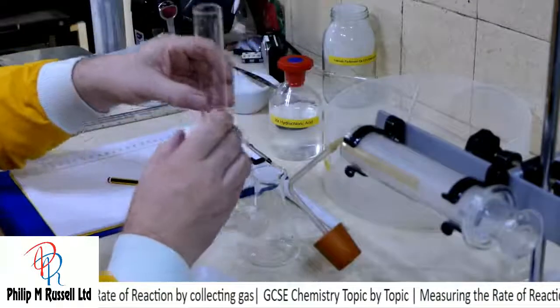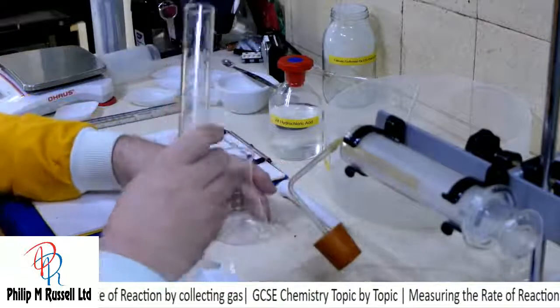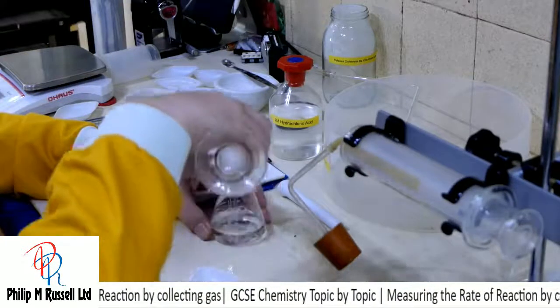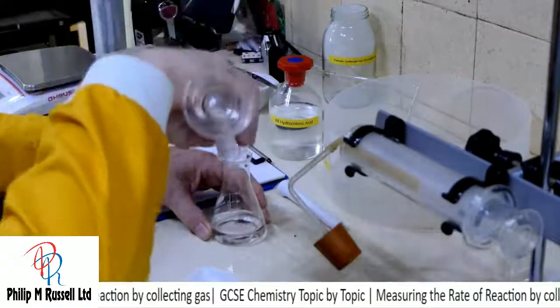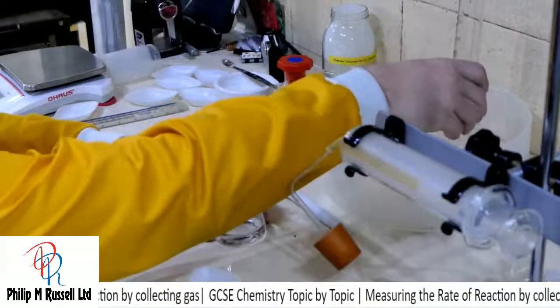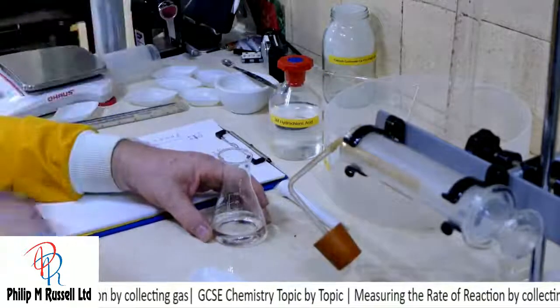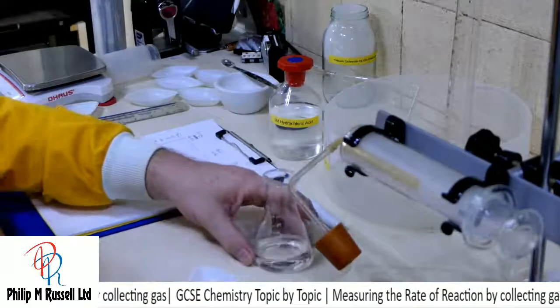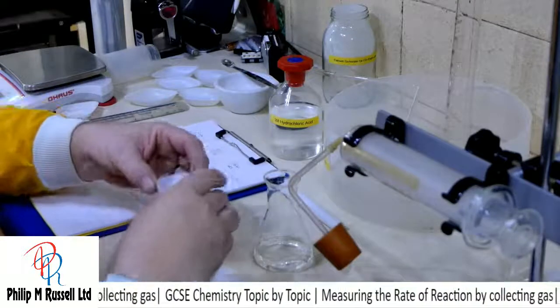One of the reasons I did this with acetic acid last time was to make the reaction a little bit slower. So if I reset that, we're now ready to start again.